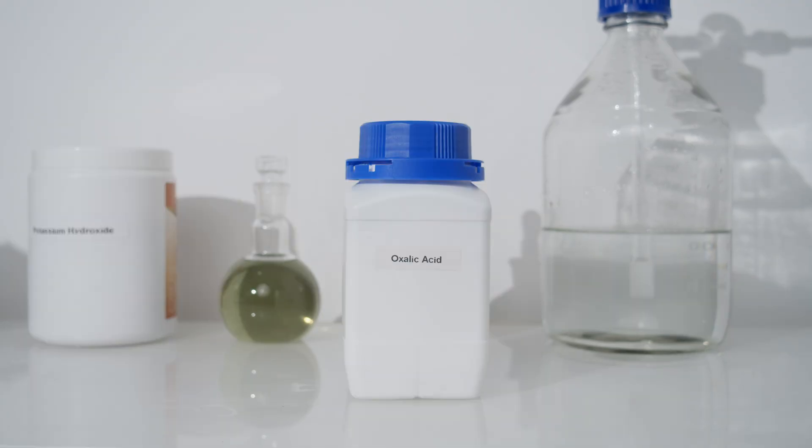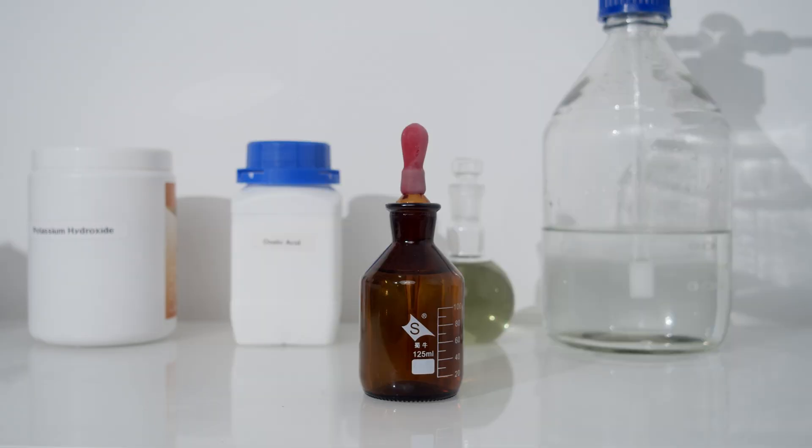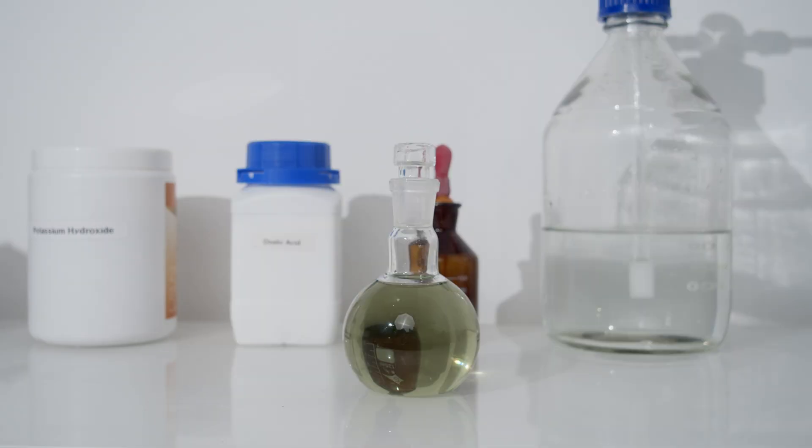For this synthesis we need potassium hydroxide, oxalic acid, distilled water, hydrogen peroxide, and ferrous sulfate.